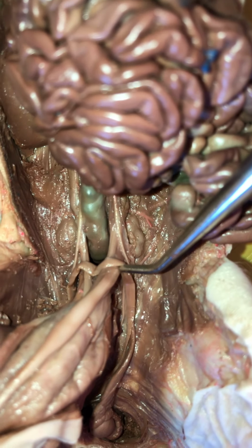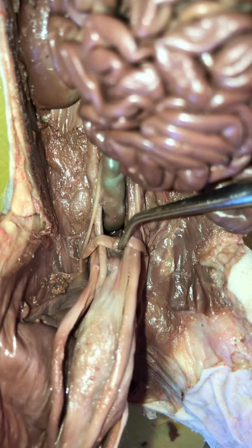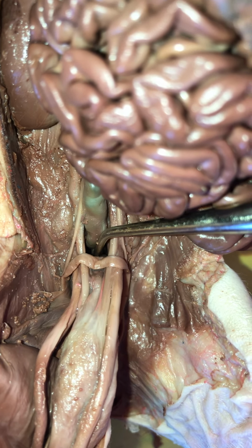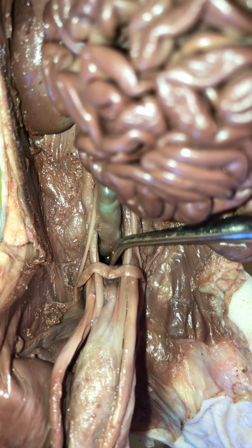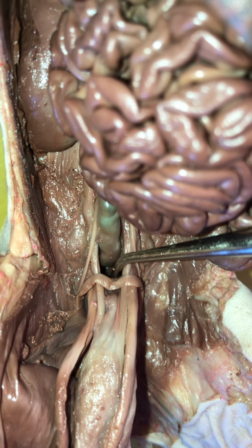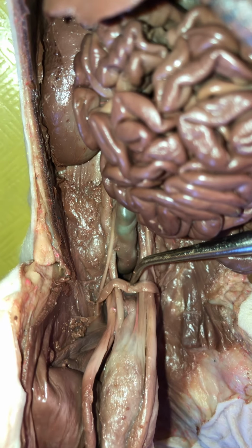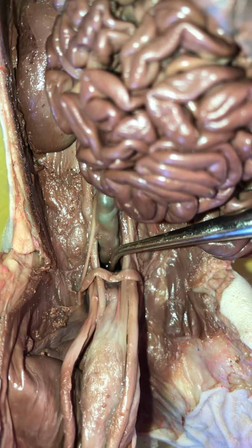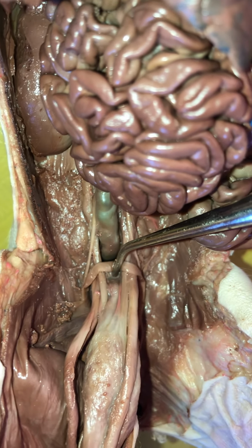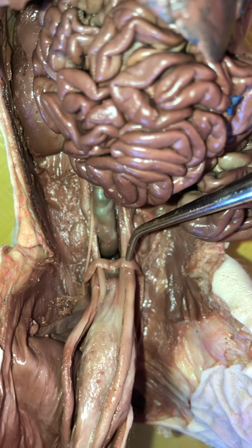And notice that it's going to wrap around the umbilical artery and then come here behind, and the ureter too, for that matter. And it's going to come here, on the dorsal aspect of the posterior end of the bladder, and it's going to meet the urethra back there, and so is its partner. So we're going to have two ductus deferens, or vas deferens, meeting here. So they're going to be conducting sperm from the testis to the urethra. So hence the urethra drains urine, and it drains sperm.